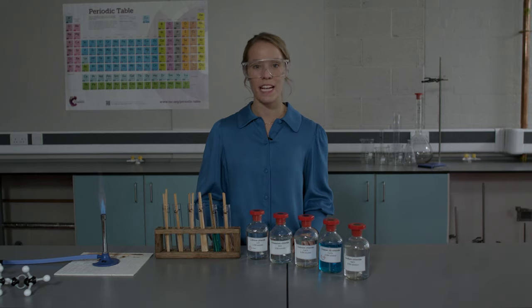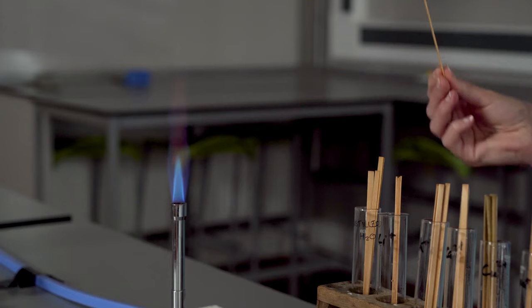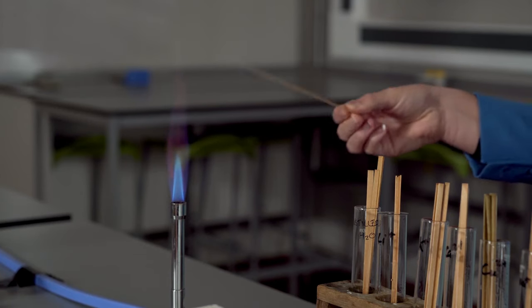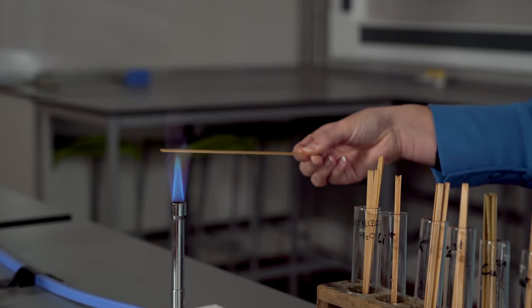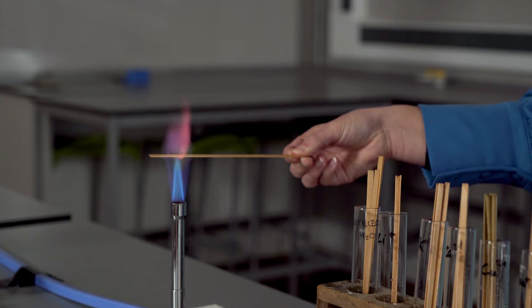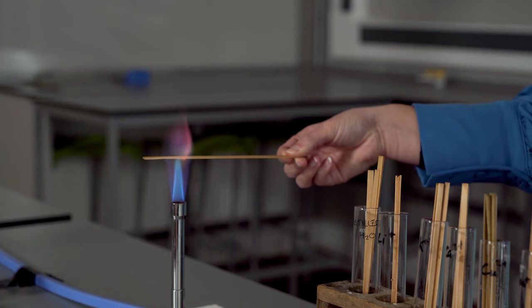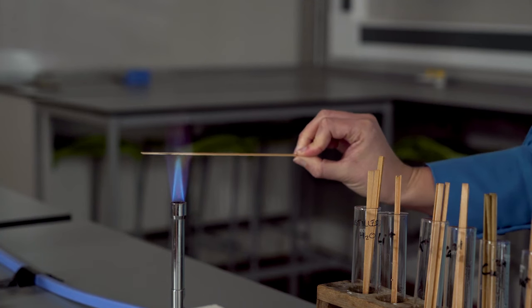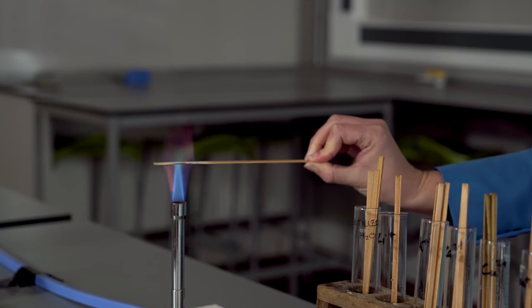Next, I'm going to test the potassium ions. This is the hardest one to see. You may be able to see a lilac flame.